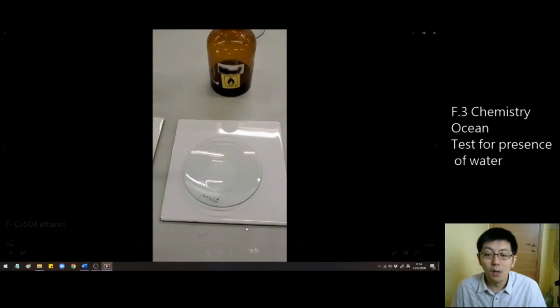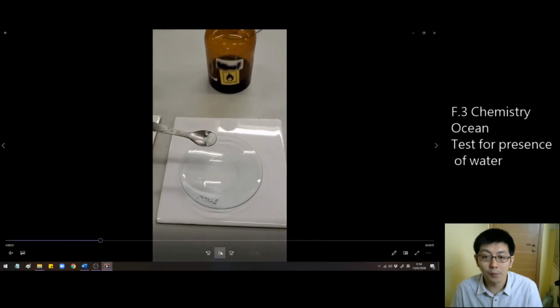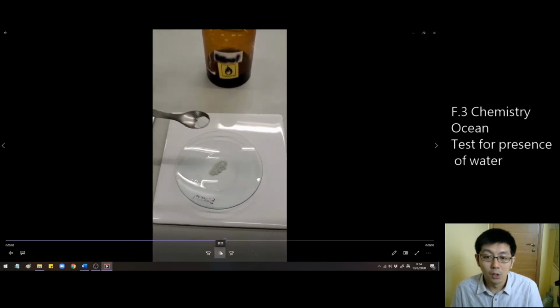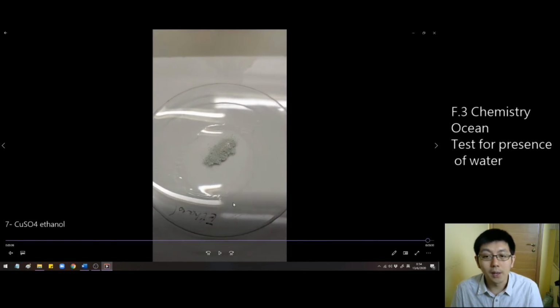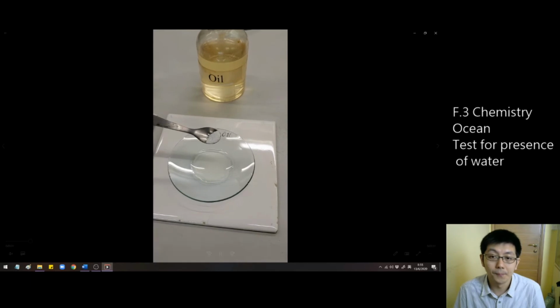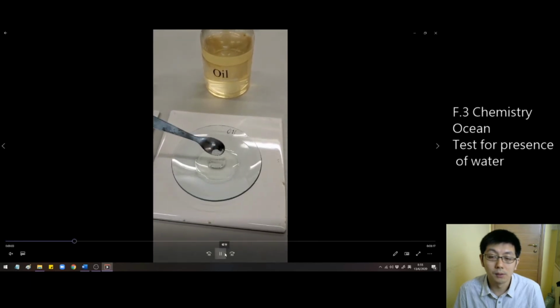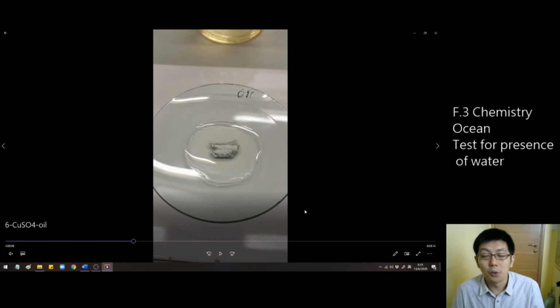Let's see. This one we're going to add anhydrous copper(II) sulfate solid into a sample of ethanol, a kind of alcohol. So see, the white solid is still white in color, no observable change. Let's see what will happen if we put the anhydrous copper(II) sulfate solid into oil. So it is still white in color.